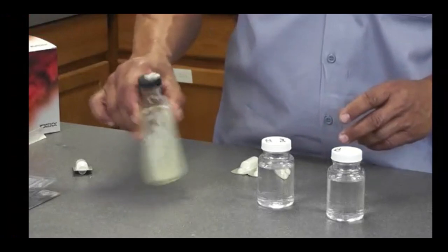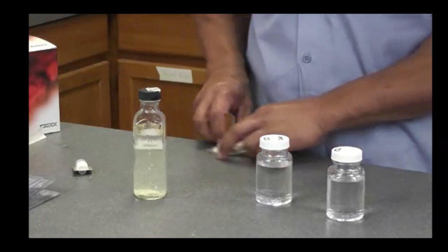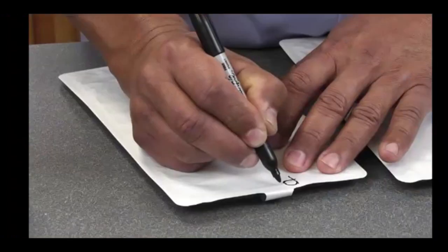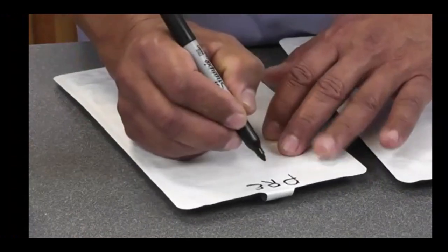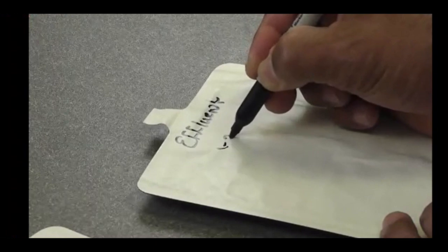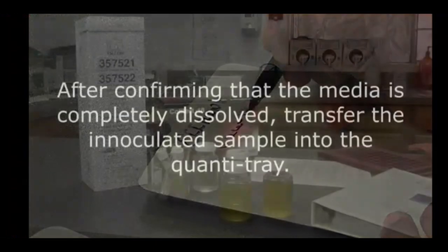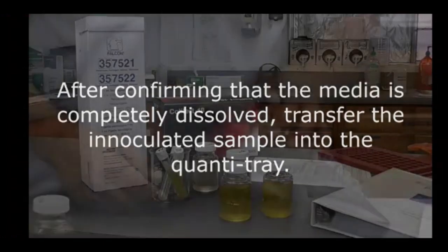Be careful not to mix the sample too vigorously, as this may cause bubbles to form that could interfere with the test results. While waiting for the media to dissolve completely, begin labeling the Quanti-Trays, 1 for each sample, including a duplicate analysis of the post-UV sample. After confirming that the media is completely dissolved, transfer the inoculated sample into the Quanti-Tray.